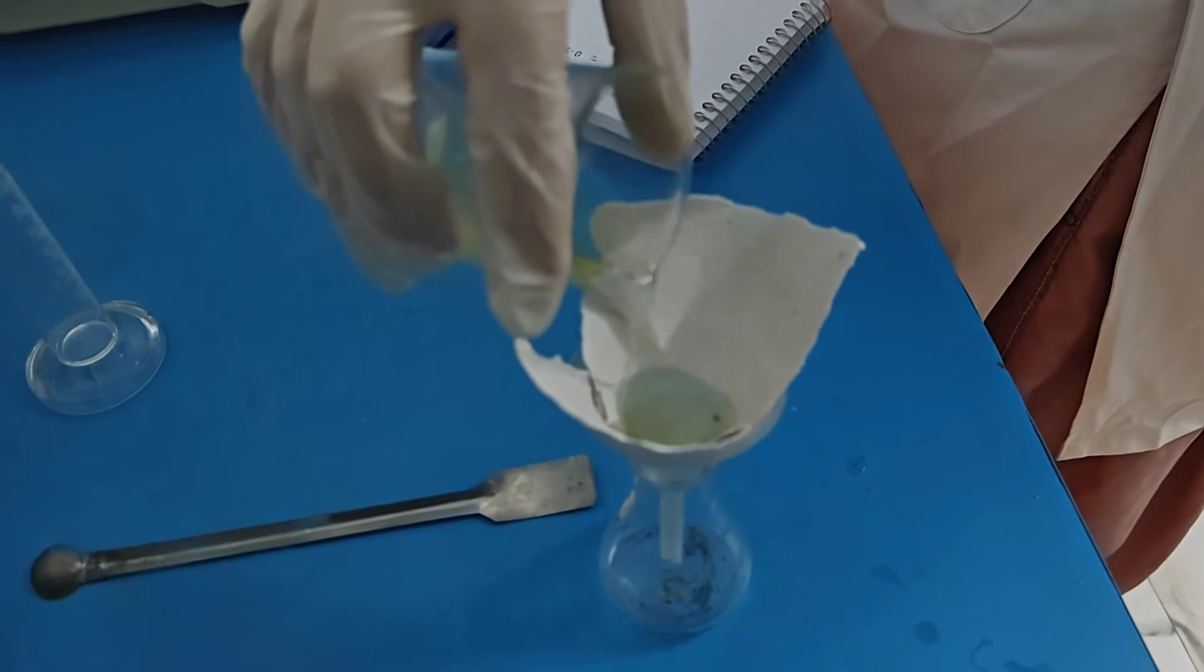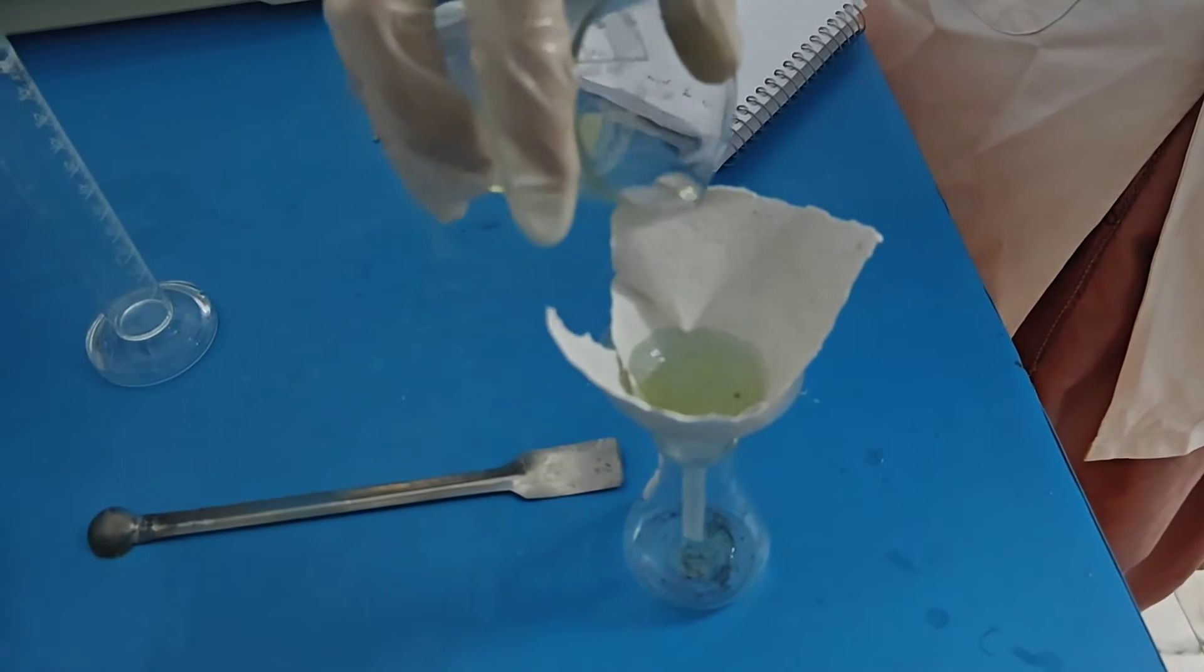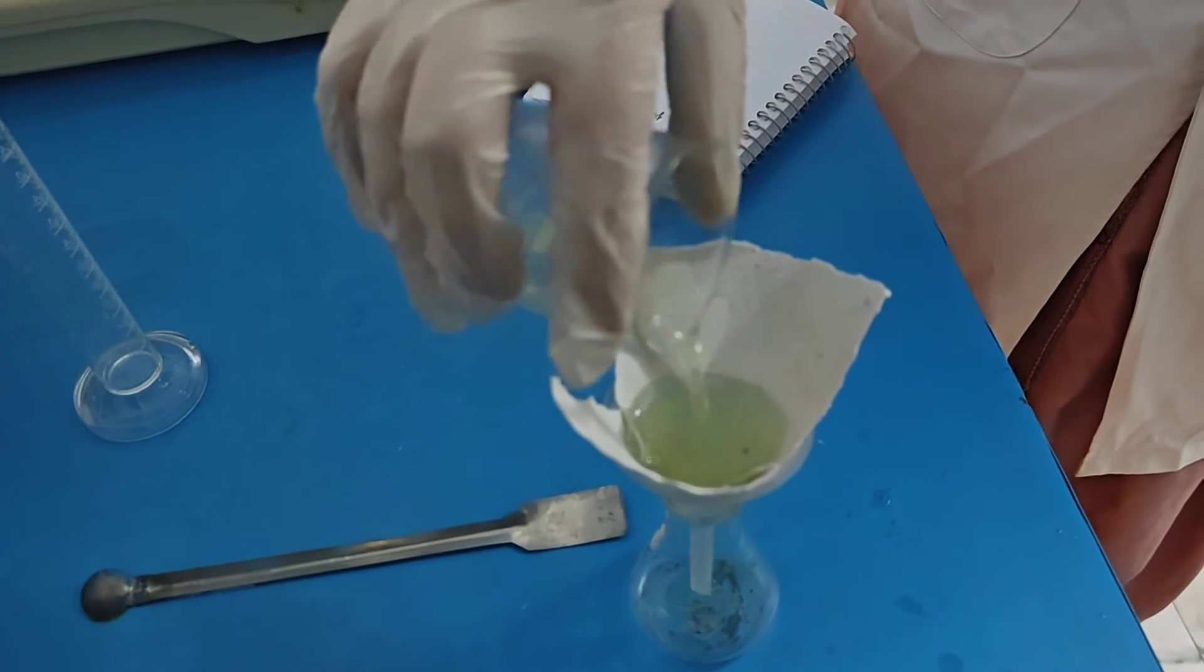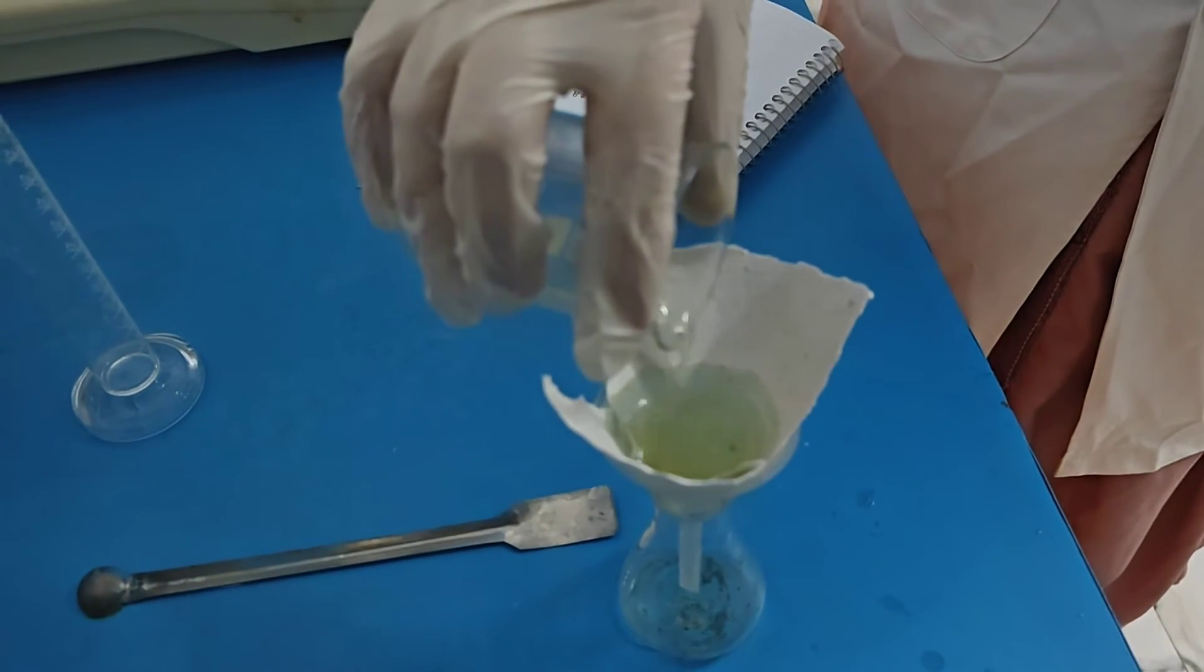Always wear the gloves when you are handling the concentrated HCl because fumes are generated.